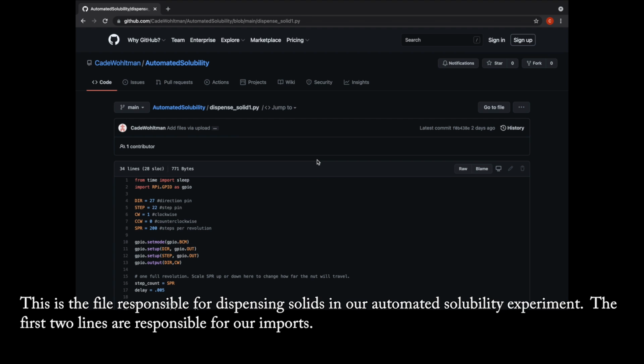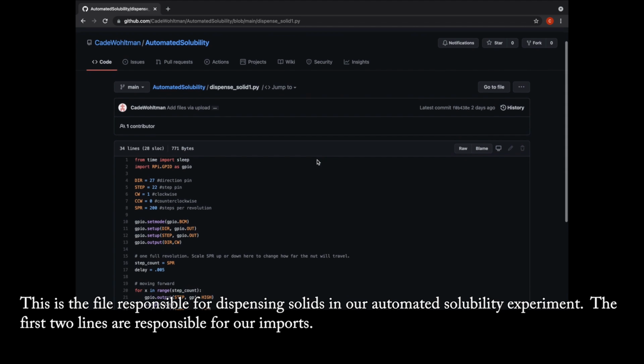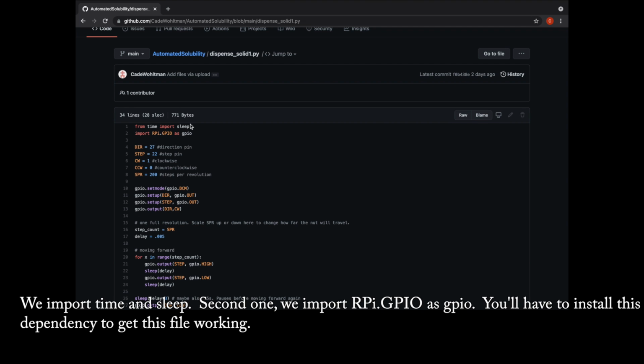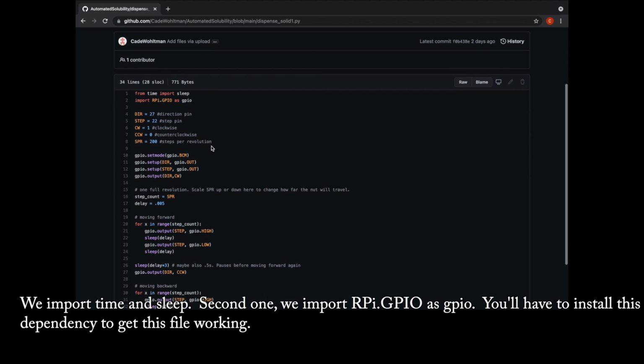Python file responsible for dispensing solids in our automated solubility experiment. The first two lines are responsible for our imports. We import time and sleep, and the second one we import RPi.GPIO as GPIO. You'll have to install this dependency to get this file working.